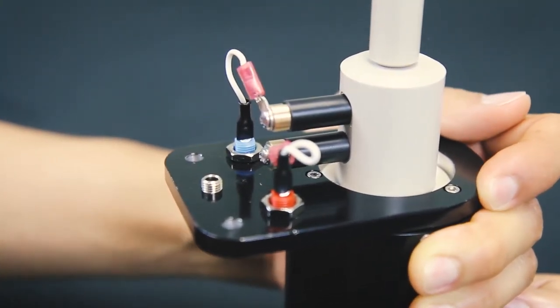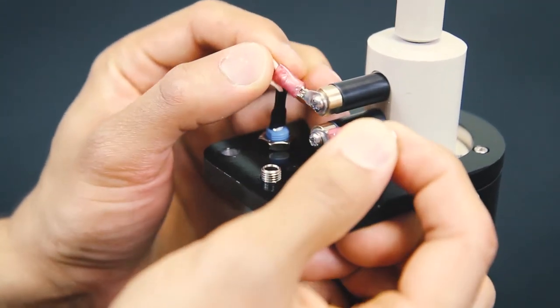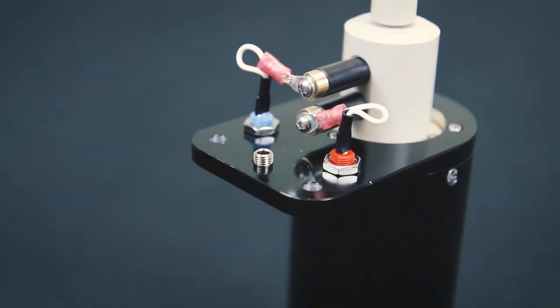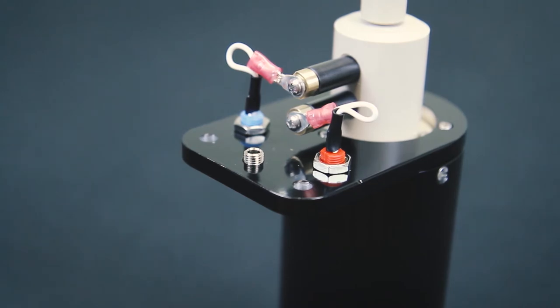Ensure the crimp is in the same orientation as it was at the beginning of this video, where the long side of the ring electrode crimp is perpendicular to the length of the shaft. Otherwise, it won't fit into the lift bracket.